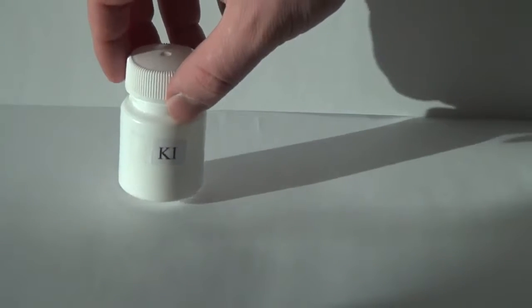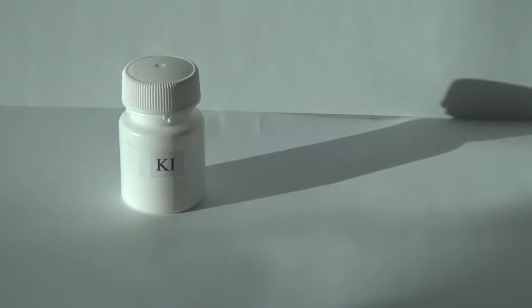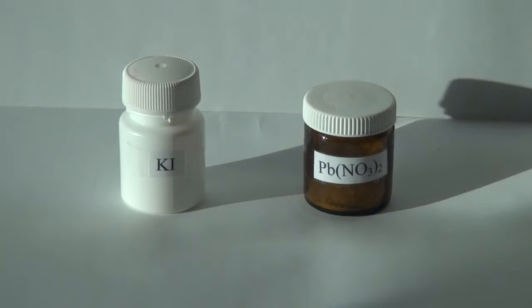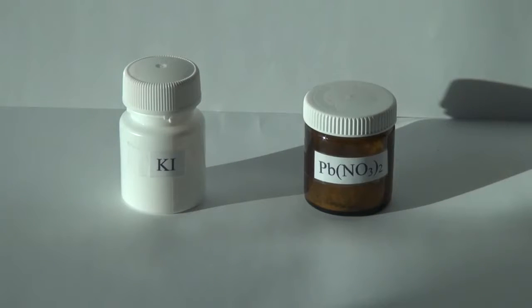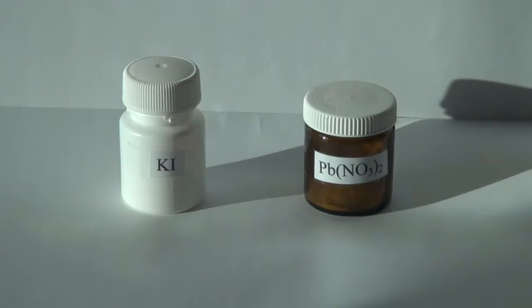Hello everyone, today we will conduct a very beautiful experiment which chemists call golden rain. For this experiment we need potassium iodide and lead nitrate.